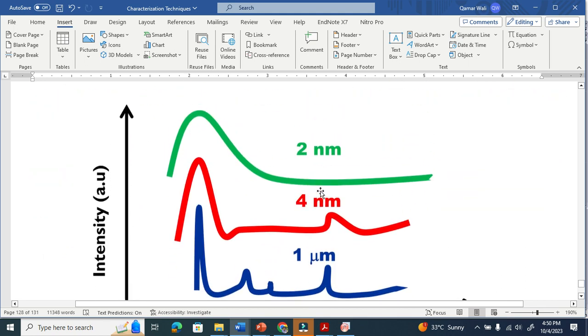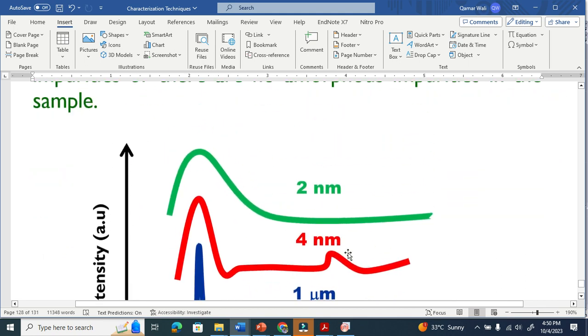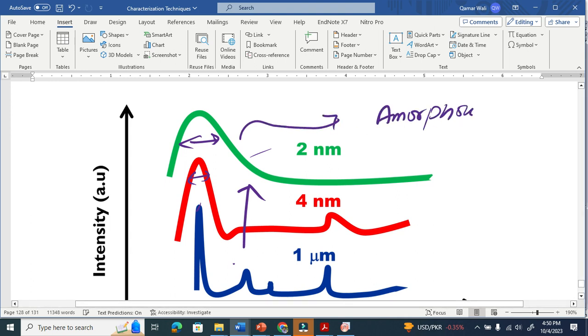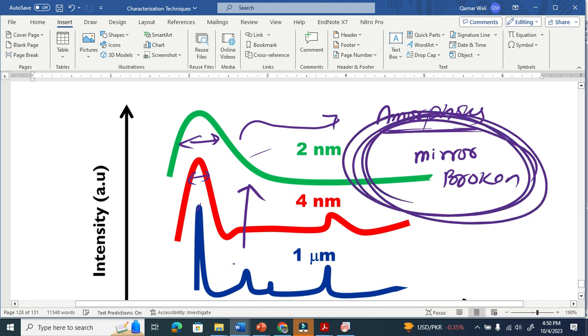If you are not sure how small particles give me a broad peak, as I explained in my past video as well, if we decrease the size, the peak you see is getting broader and broader. And this is the same as amorphous also. The amorphous material also gives you a broad peak. I gave the example of a mirror, but a broken mirror. If you shine light on a broken mirror, it will give you diffuse light like this. You see here?